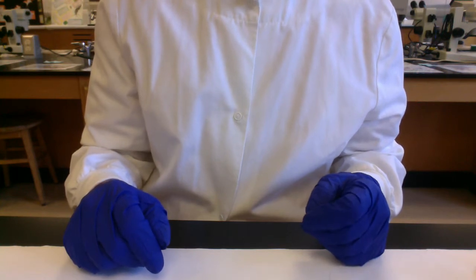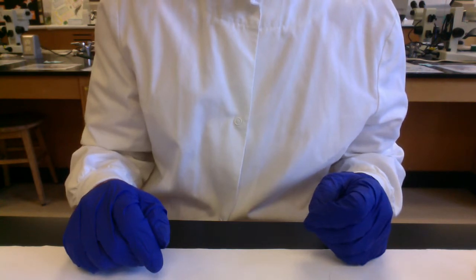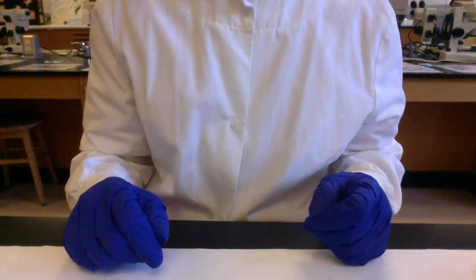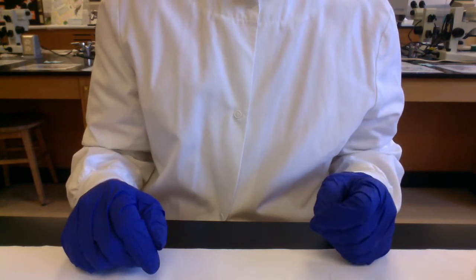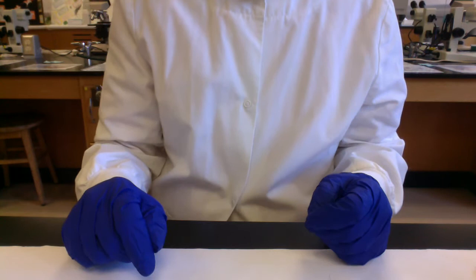The first video was kind of an introduction to microbial growth media. So for this second video, folks, we're going to be sampling airborne microbes using different microbial media. In the spring 2020 lab manual, this starts on page 115 and goes to page 116, where there are tables to record your results. So I'll show you how we would set it up. I'll actually run the experiment and then I'll come in this weekend to do the colony counts.